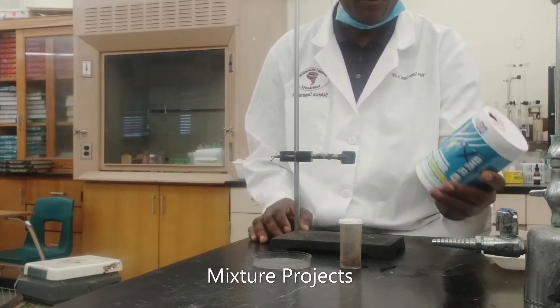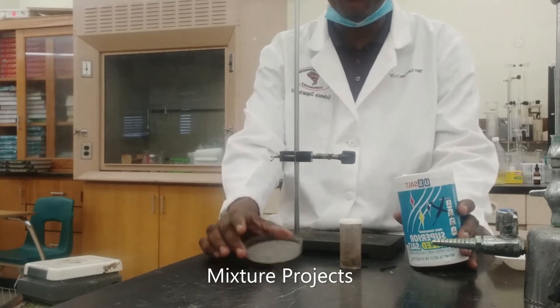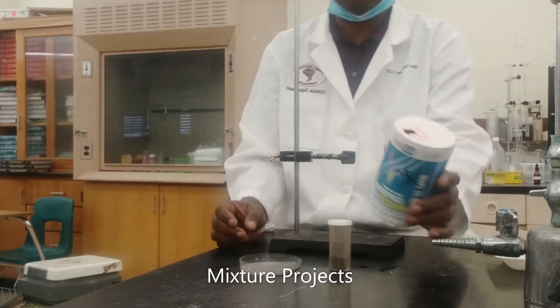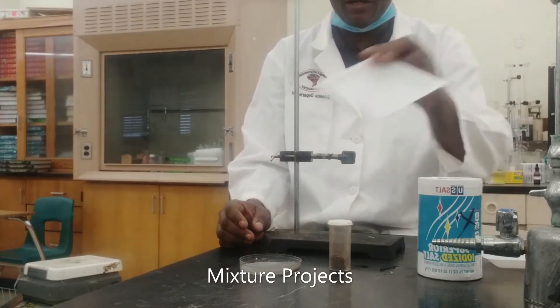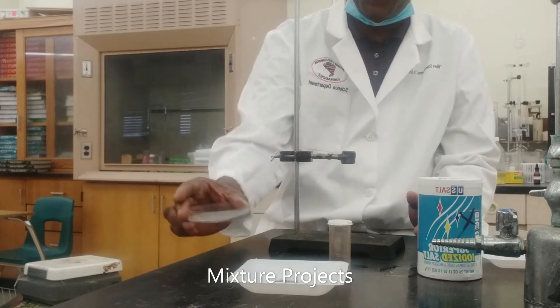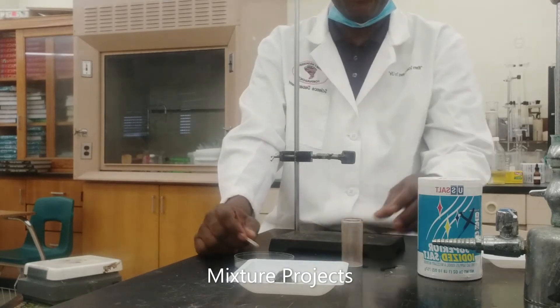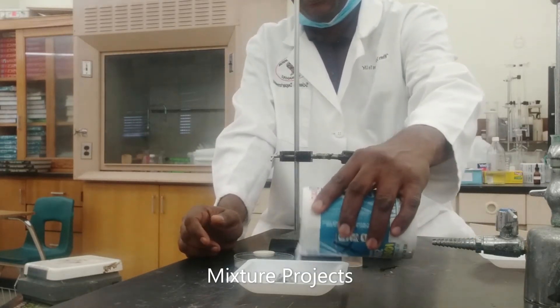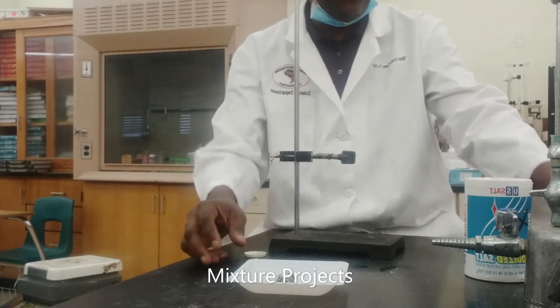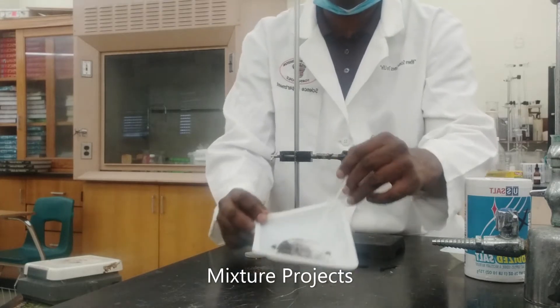The first one we want to experiment on is a mixture of sand. Here I have sand, iron filings, and salt. I'm going to go ahead and create the mixture and then we're going to use the individual physical properties of each component to separate it. And some salt — alright, we're gonna give it a stir to have it mixed properly.